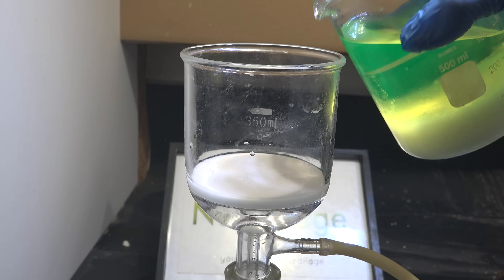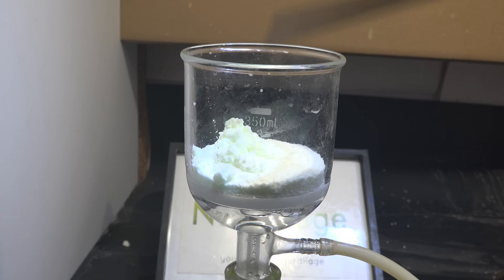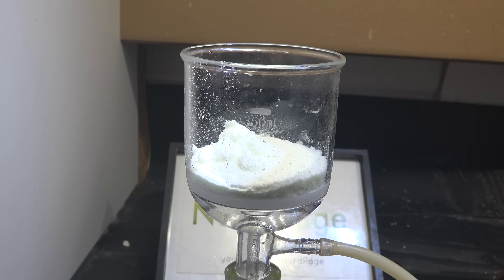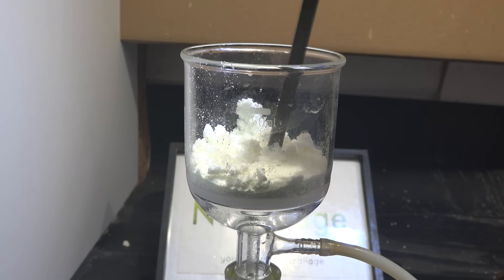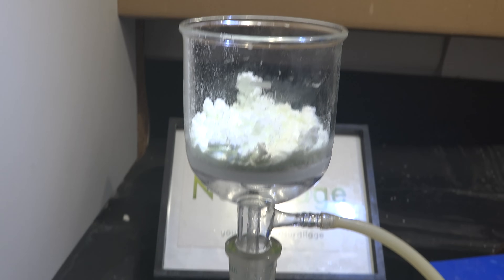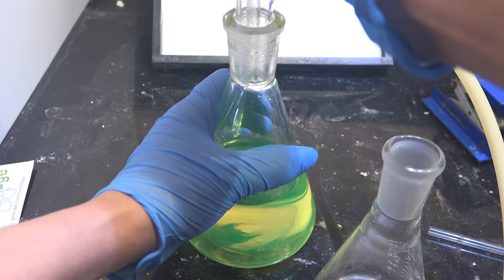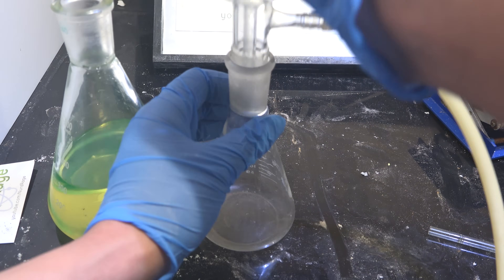Now we simply vacuum filter our guanidine carbonate. Be sure to wash the guanidine carbonate with some more acetone to remove as much of the additives as possible. And that's it — guanidine carbonate. Now a lot of additives are in the filtrate, but some precipitate out and are stuck to the guanidine carbonate, so we're going to need to get those out as well.